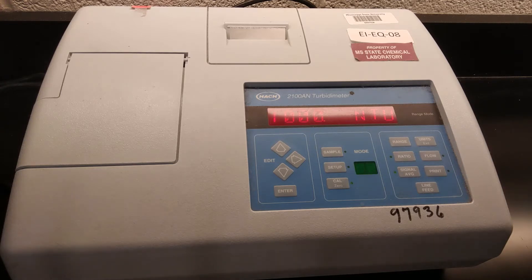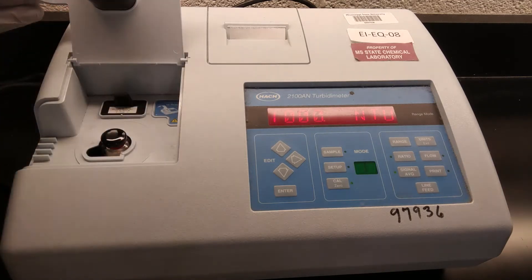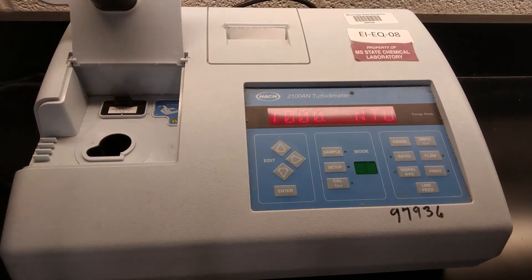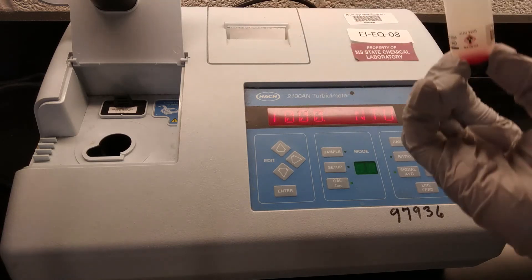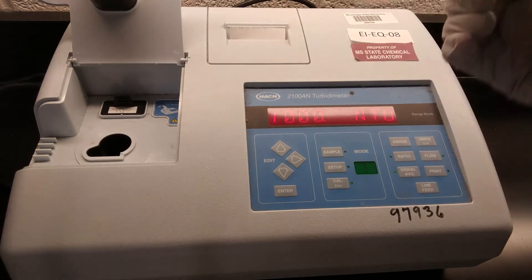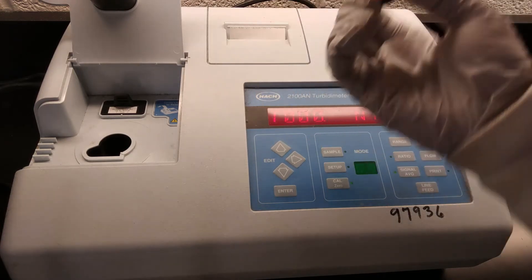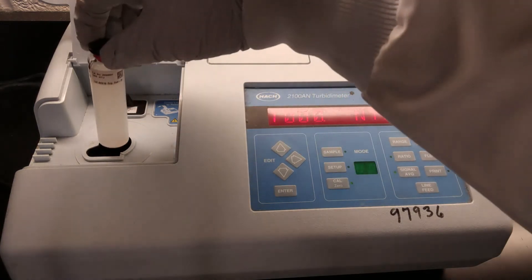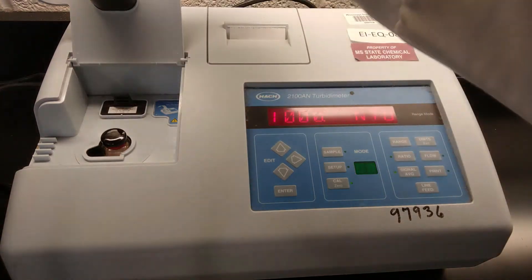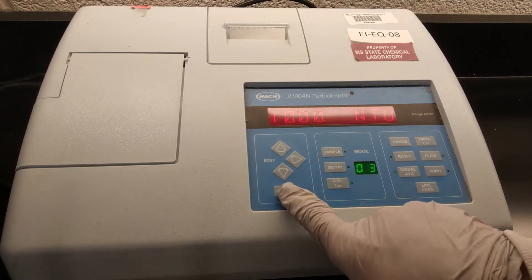Okay, the 200 is done. So now we can take that out, put it back in its case, bring out our 1000. I can't actually see any larger particles in there, but I can't see a lot going on in there to begin with because that is getting to be a pretty cloudy mixture. So I'm going to give that a few inversions and then set that to go.